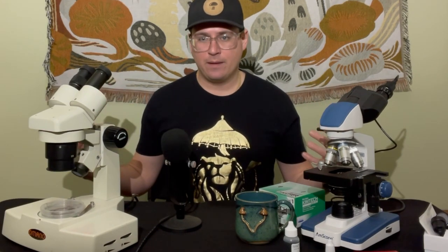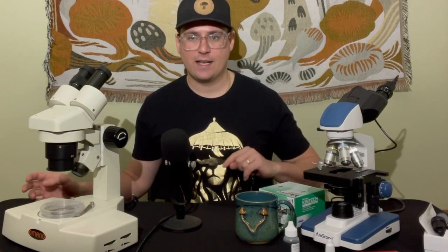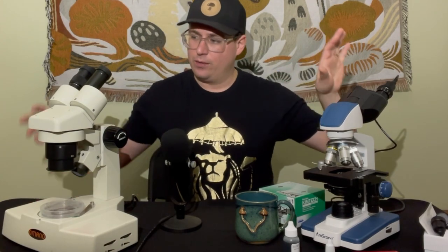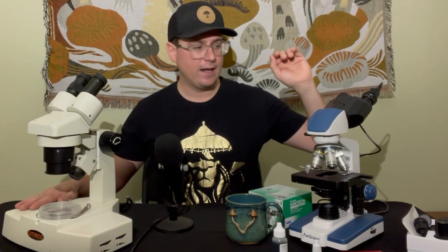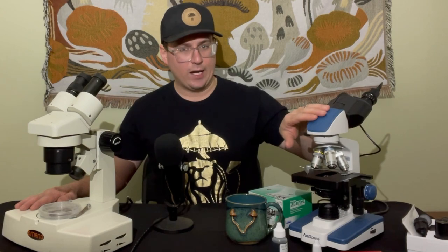You can see I have two different types of microscopes in front of me. They're essentially the same but there are some differences. There's the stereoscope, which is this tan one on my right, and the compound microscope, which is this blue and white scope on my left.